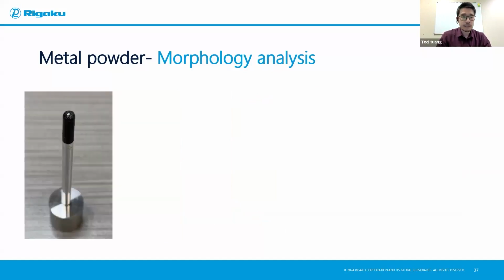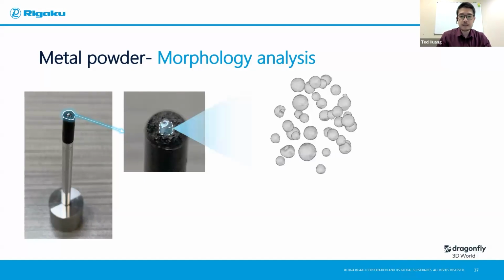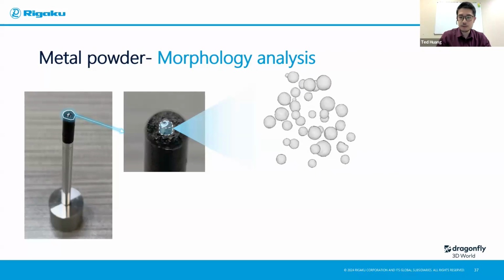And how I mounted it is I just put some glue on top of a pole and mixed those powders in. So this is a good thing about X-ray contrast. Remember, the contrast comes from your material type. In this case, through the eyes of X-rays, those glues are essentially invisible. So those powders are as if they're floating in the air. So after scanning, this is what I get. You have those powders floating in the air, waiting for you to explore.